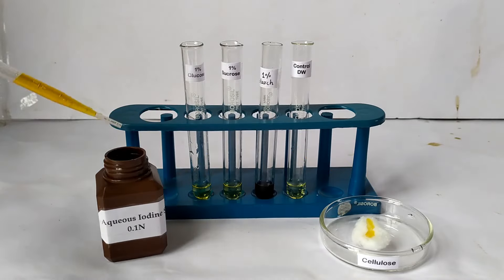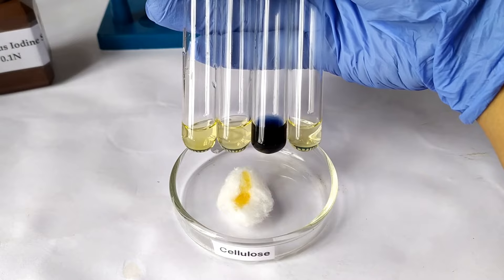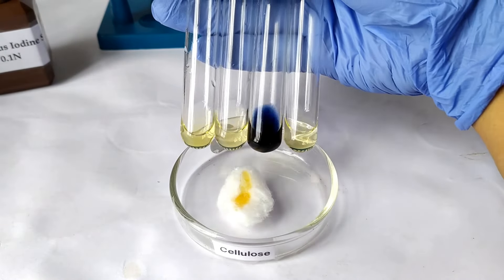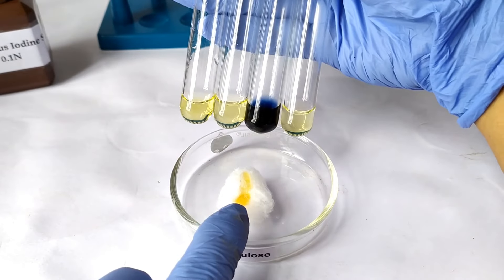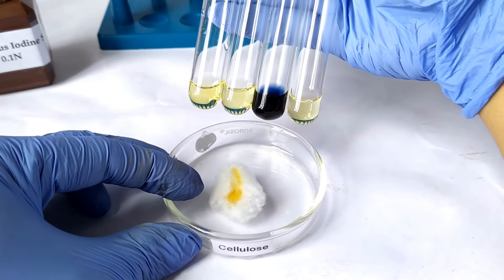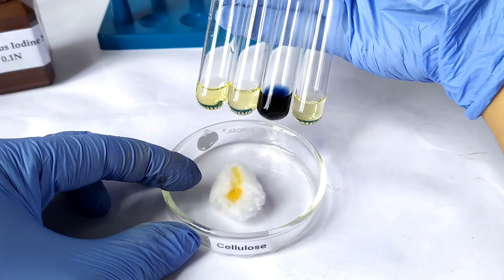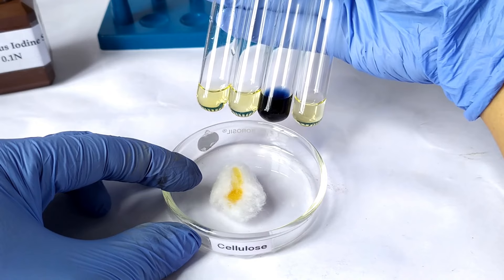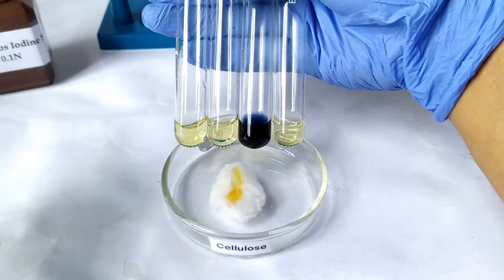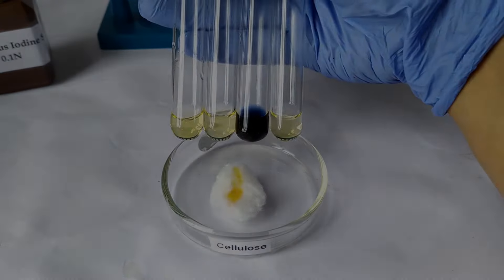Observe the change in color in the samples. You'll notice that the test tube containing the starch solution shows a rapid development of a deep blue-black color. All the other samples including the control test tube retain the original iodine color. Similarly, starchy foodstuffs like potato, bread, and boiled rice all give a blue-black coloration with iodine. This shows that iodine gives a color reaction only with certain polysaccharides such as starch.